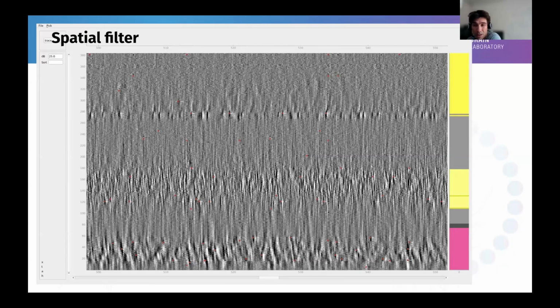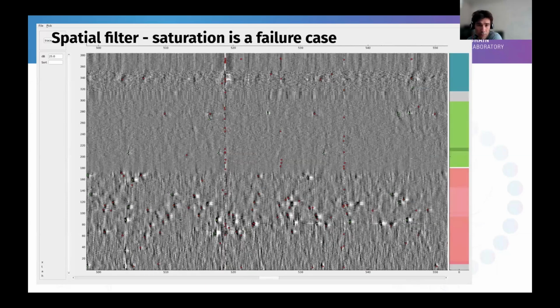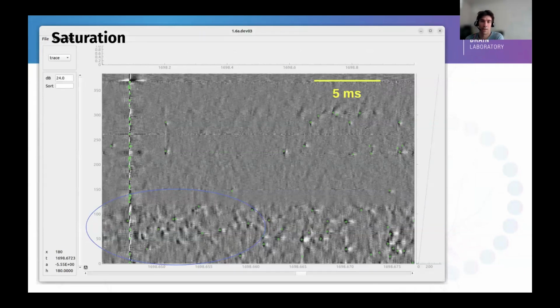I think what's important is to look at the failure cases, if you're doing some experiments. The failure case of this destriping is the saturation. Here we can see something that doesn't necessarily look as bad as what we had before, because we can see the spikes underneath. But if you look after this destriping, you can see that at some point it's impossible to take out the noise. What is happening here is that the signal is saturating. We are saturating the probe, and we cannot record there. And this is creating artifacts. The problem of the saturation is that it's going to induce false detections by the spike sorter, at least by Kilosort, which we are using. And those false detections are going to impair the clustering.